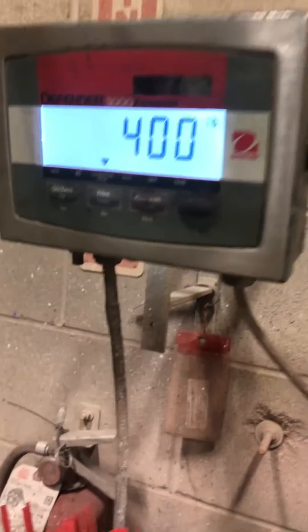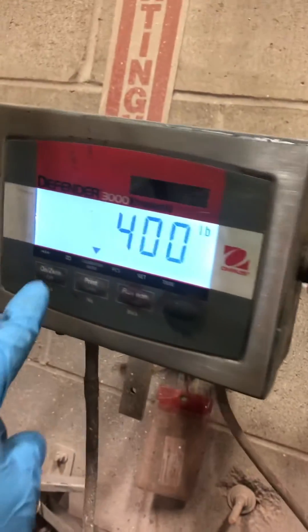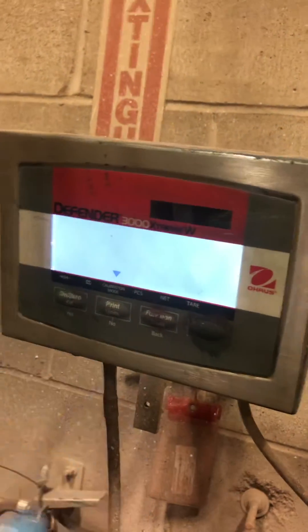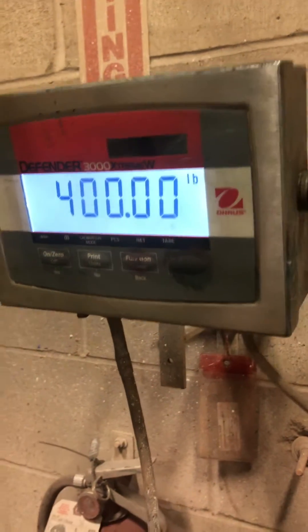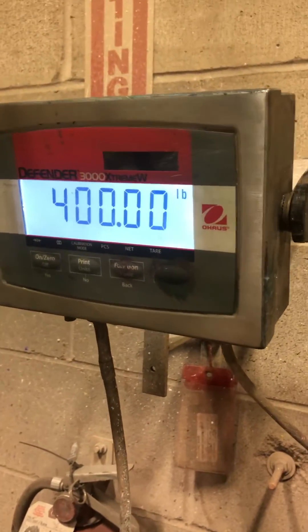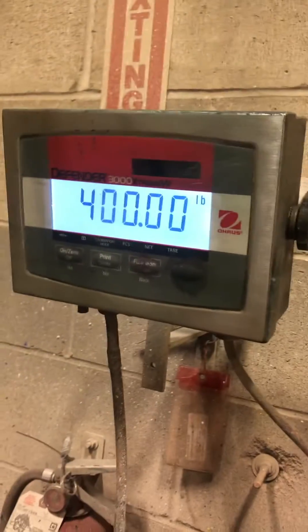Apply the 400. Give it a couple of seconds to stabilize. The yes is the key. And if it accepts the adjustment, if everything goes well, it bounces right back out into weighing mode.